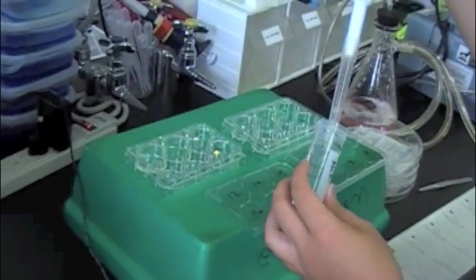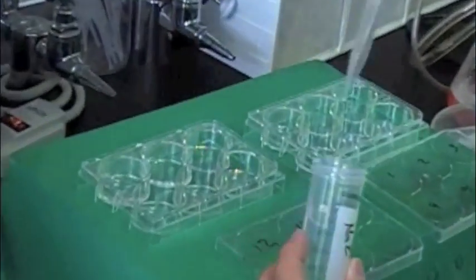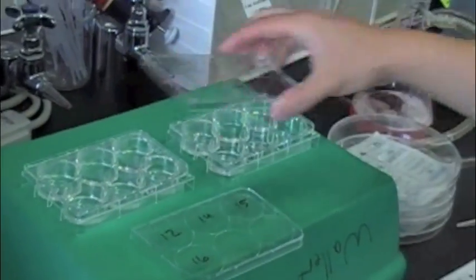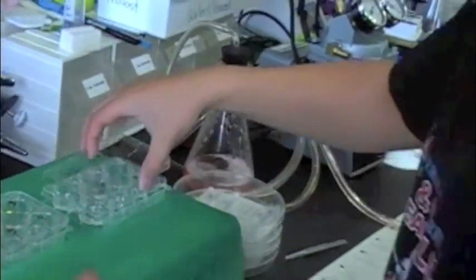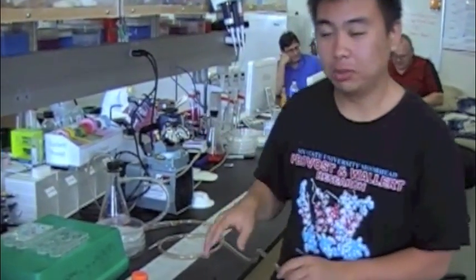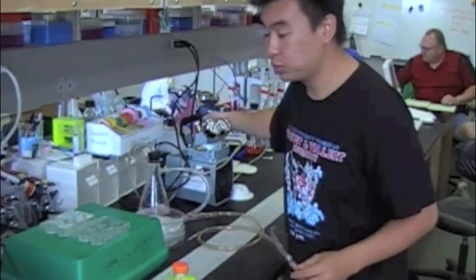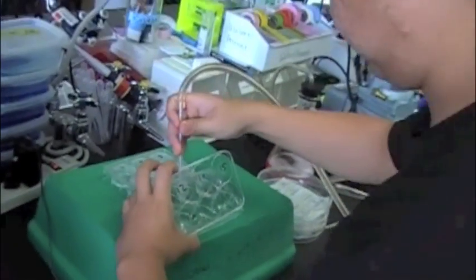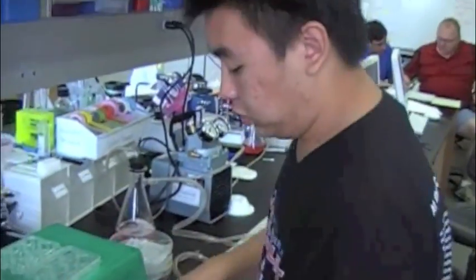Add the NA2 buffer carefully so as not to disturb the cover slips too much, because rocking them will make the cells round up and lift off the cover slip, which you don't want. Once the NA2 buffer is added to each well, cover the plates and put them back in the incubator for about 2 minutes. After the 2-minute wash, put the plate back on the insulated surface and remove the old NA2 buffer with the vacuum system. Then add a fresh 2 mL of NA2 buffer and incubate for another 2 minutes.